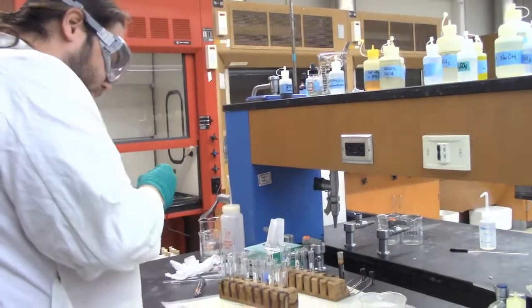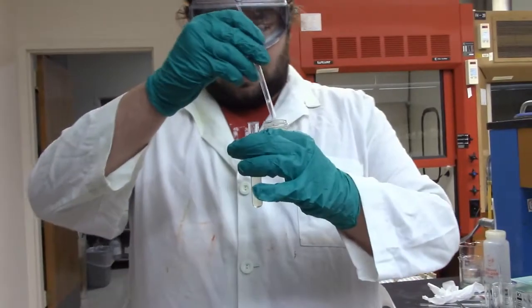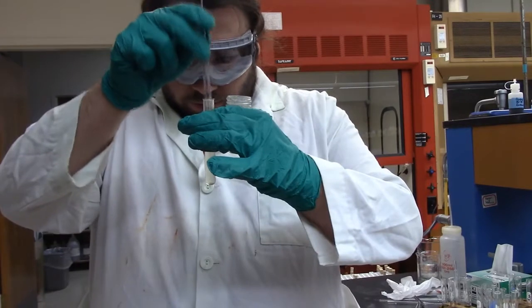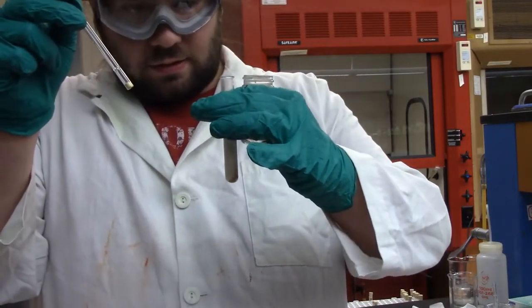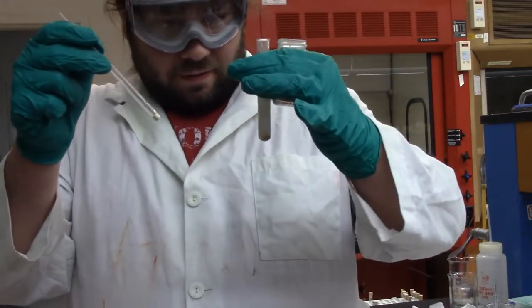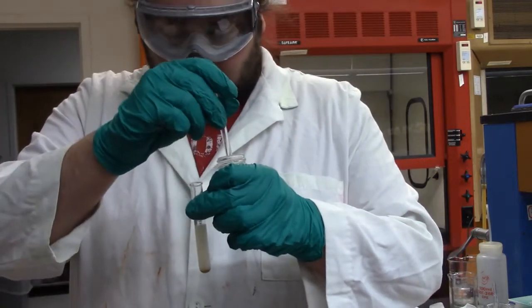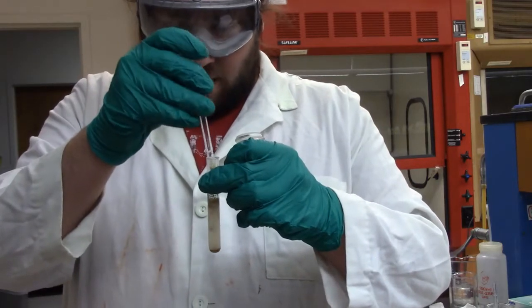If you remember how we do this, I'm going to try and do it stupidly so you can see it on the camera. I get a scoop of this, I put it in there. It goes ahead and reacts. Ooh. And almost goes over the top and is actually quite hot. You okay? Yeah, I'm good. I'm dropping that stuff though. I'm going to have to clean that up later. Dies down. Add a bit more.